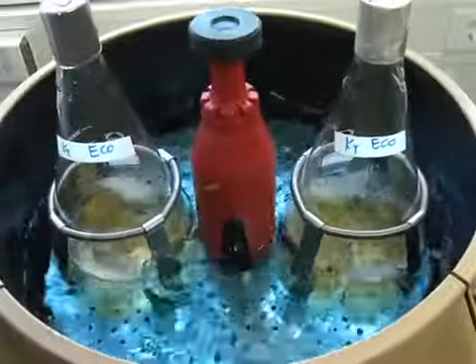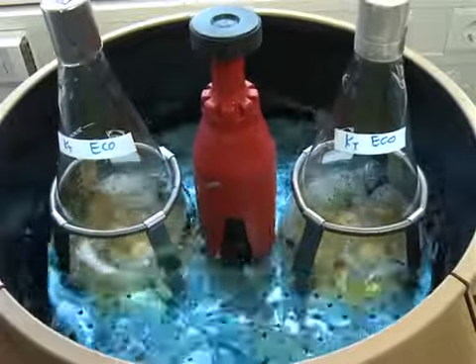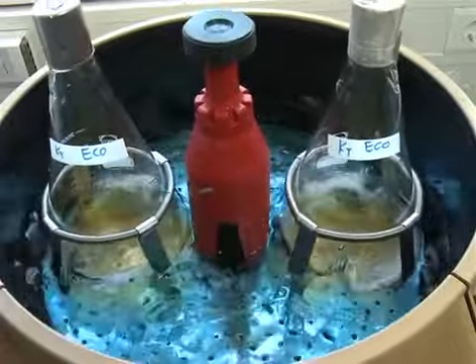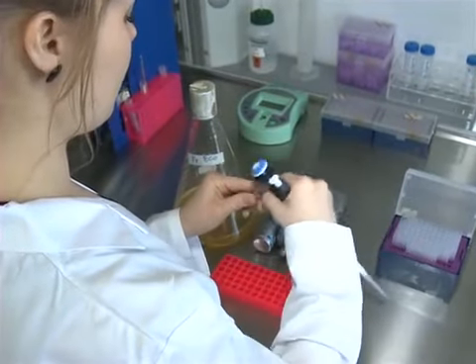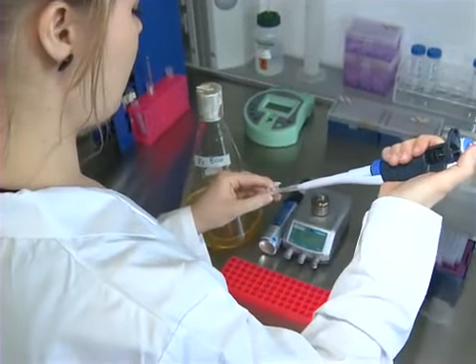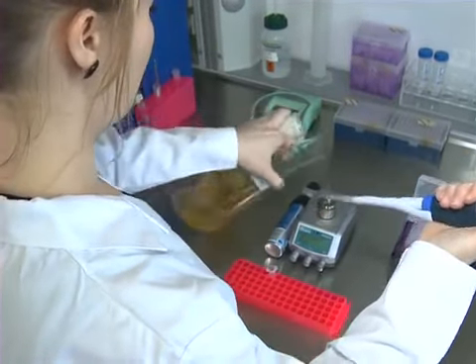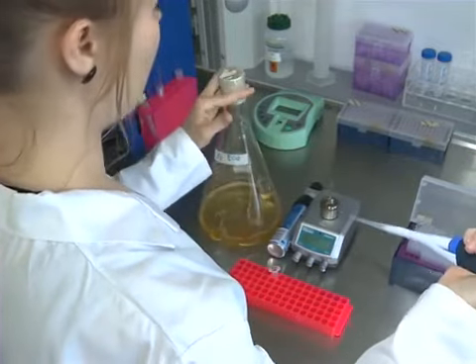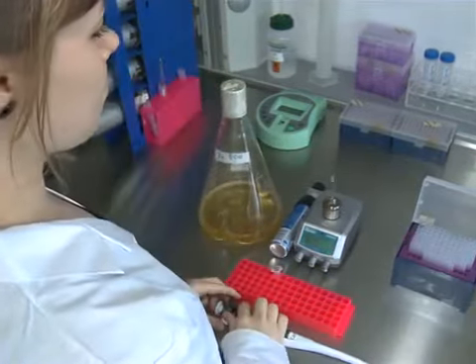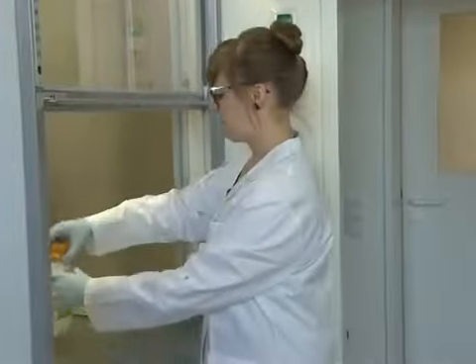To begin this procedure, grow bacterial cells expressing the membrane bait protein with a C-terminal strep tag fusion. Induce the expression of membrane bait proteins at early log phase by addition of 0.5 millimolar IPTG to 500 milliliters of medium. To allow sufficient expression, incubate the bacteria until the late log phase. Prepare to perform formaldehyde cross-linking under a safety fume hood due to the toxicity of the formaldehyde.